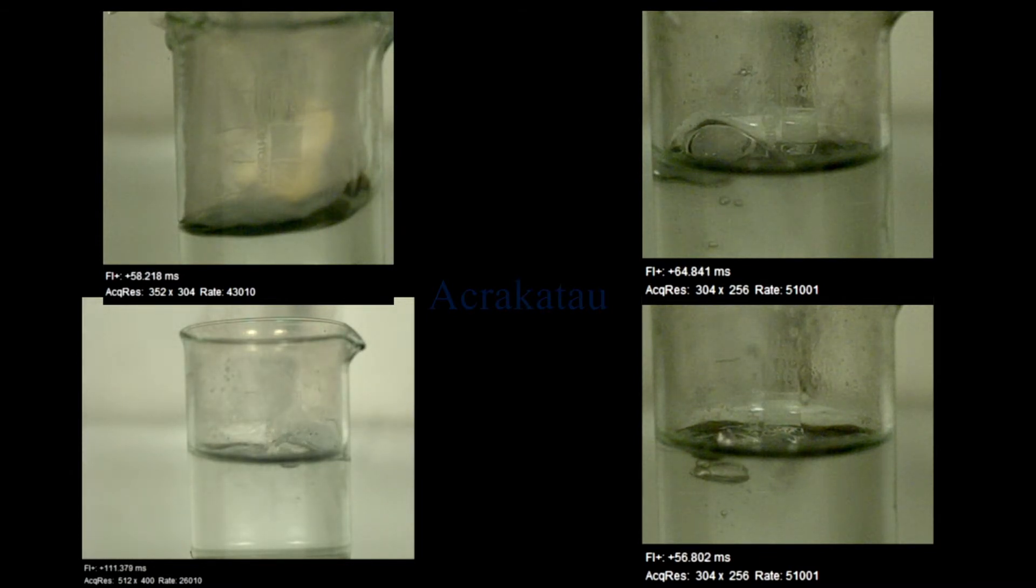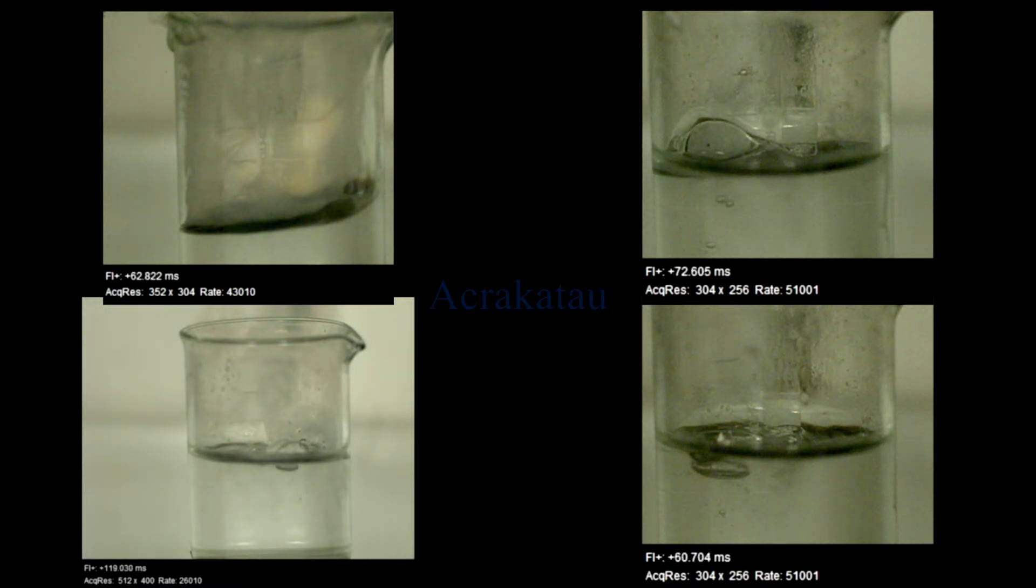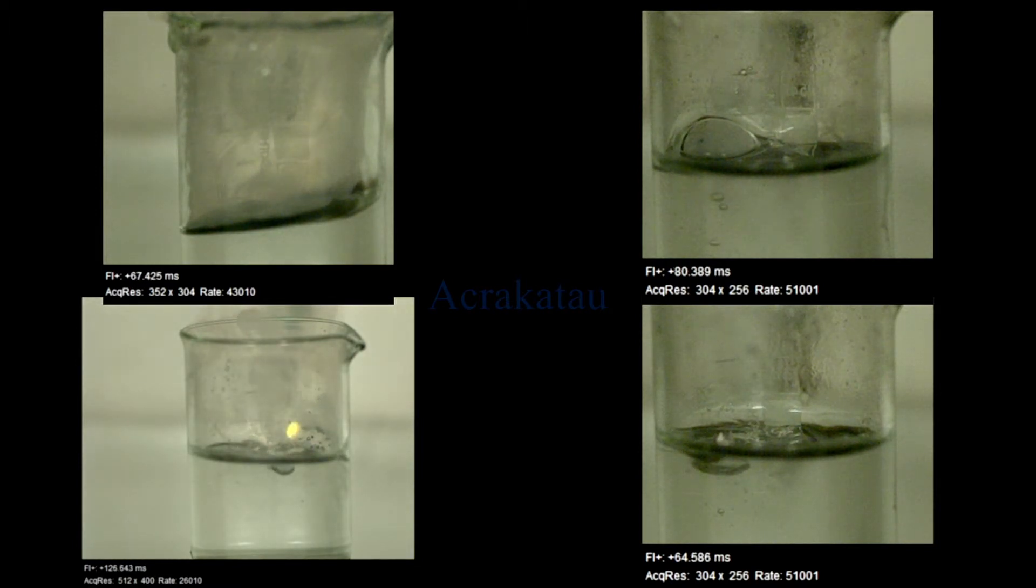Only now you can see the bubble bursting and the hydrogen in it getting ignited due to small pieces of sodium left. But if you look at the timestamp you see there's only milliseconds between these events.